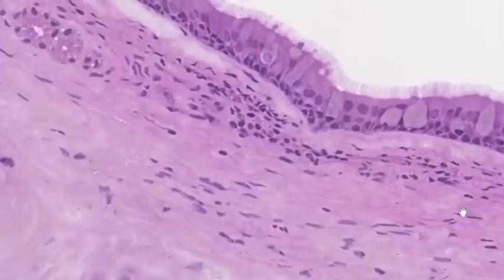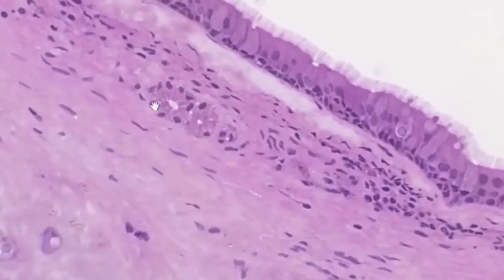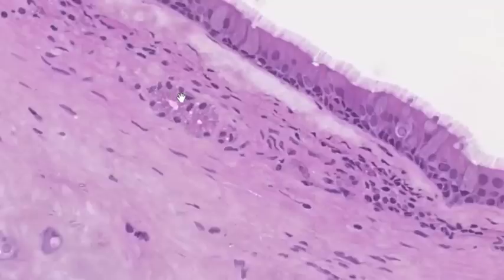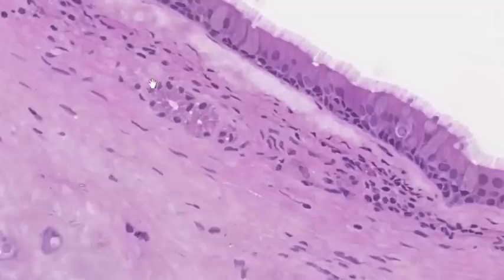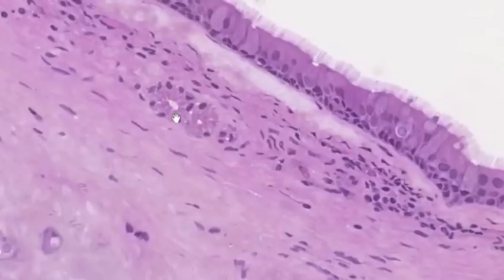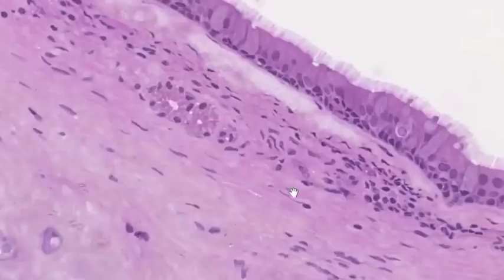Another feature of the trachea visible in the connective tissue immediately beneath the epithelium are occasional clusters of small tracheal glands. Sometimes these clusters can be considerably larger, and these glands also secrete a mucus component onto the surface of the epithelium. You can see both secretory portions and little ducts of the glands here, and at higher magnification you'd see the cells are filled with small eosinophilic staining granules.